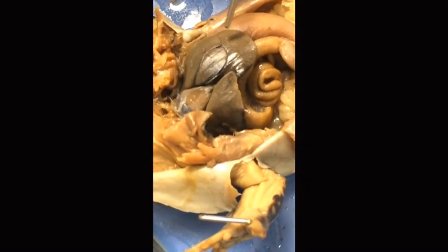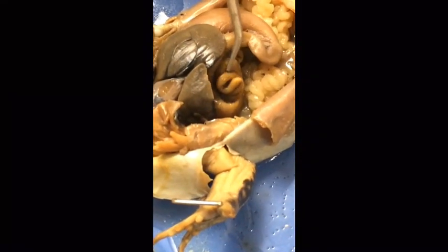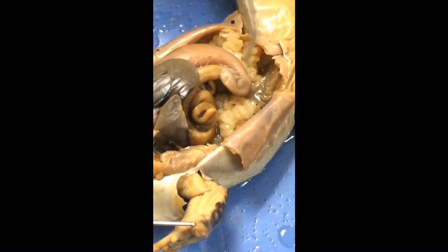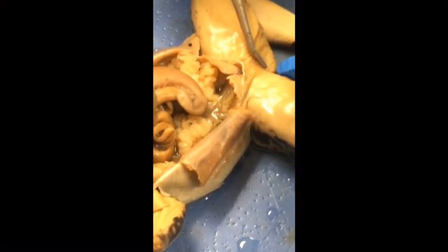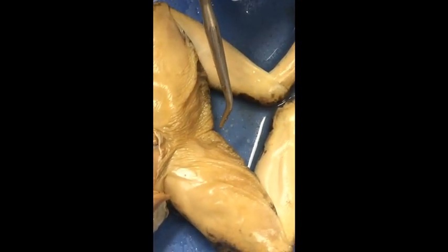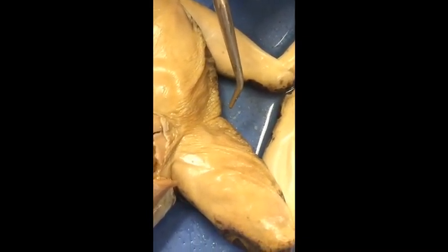The food moves from the stomach into the small intestine right here. From the small intestine it goes into the large intestine, which is this lighter color right here. Then it moves down to the cloaca, which secretes urine, reproductive tissue, and waste.